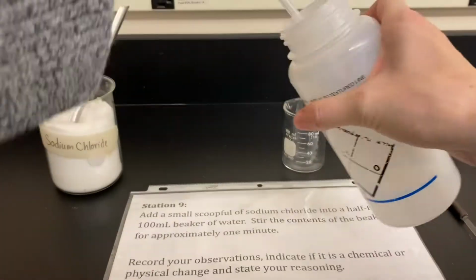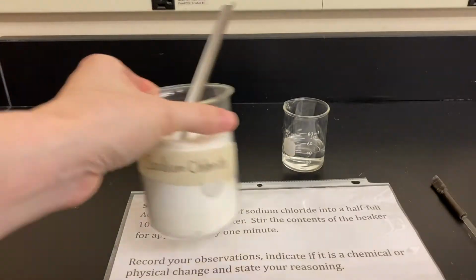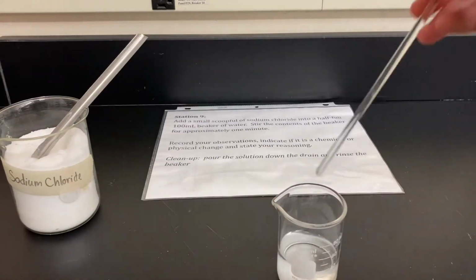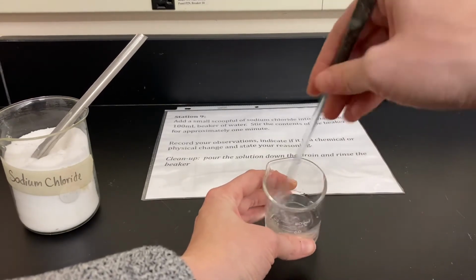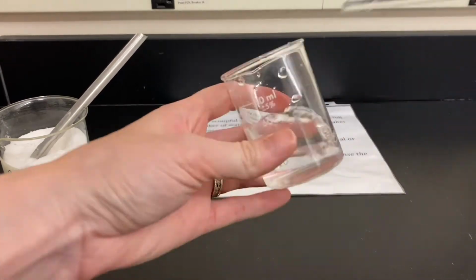Station 9, probably the lamest station we have. I'm just gonna put some distilled water in this beaker and add some table salt or sodium chloride. And I'm gonna mix it up. They can't all be chemical changes, right?